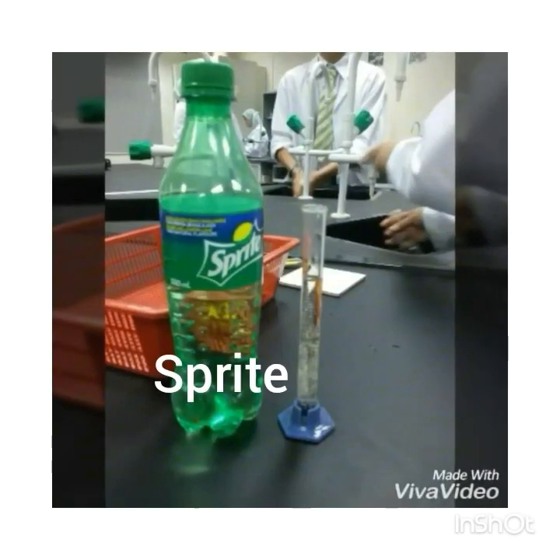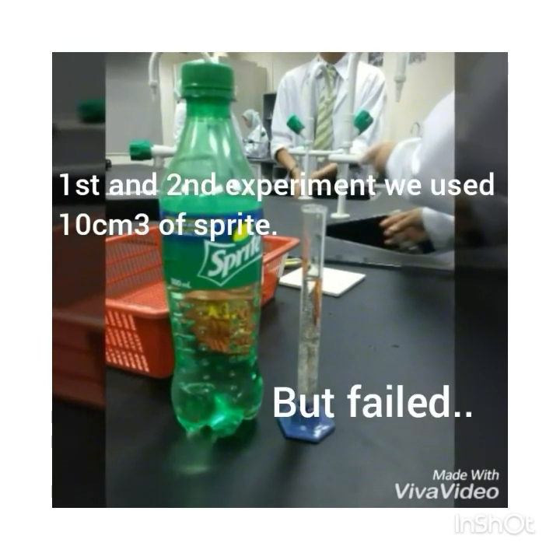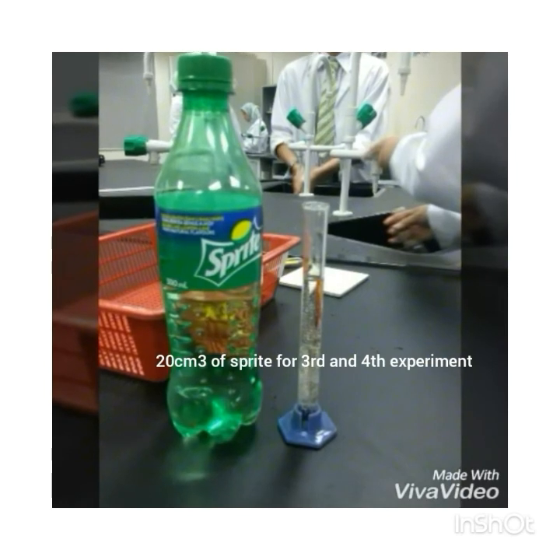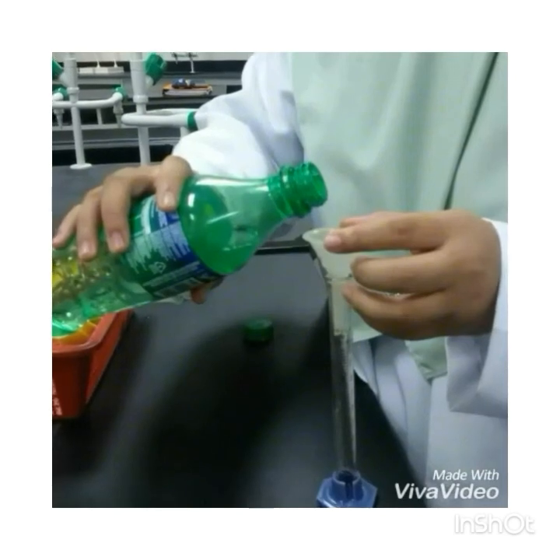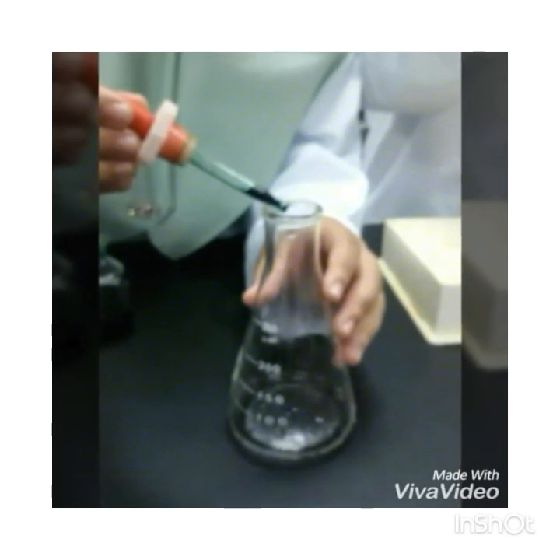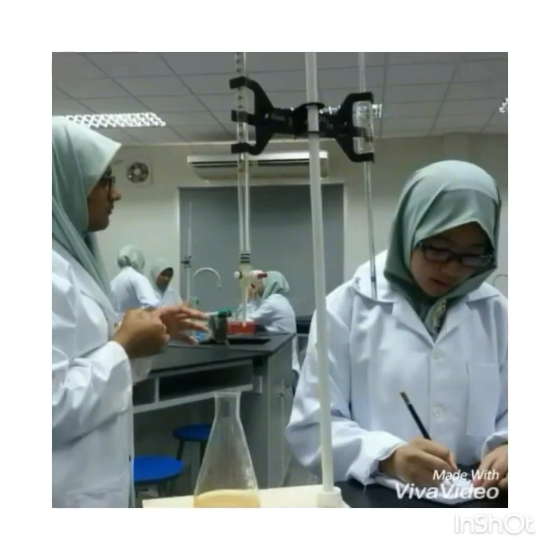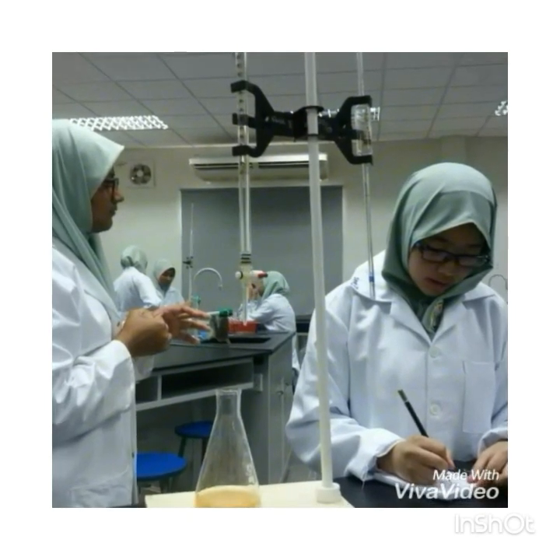Last sample we tested is Sprite, and we tried out Sprite for 4 times. The first 2 we used 10 centimeter cube of Sprite, and it did not work out. So we used 20 centimeter cube of Sprite for the third and fourth time, and then used 4 drops of indicator. We also followed the same process for the 3 other samples, which are lemon, lime, and orange. We added sodium hydroxide into the conical flask of Sprite until it turns to orange color.